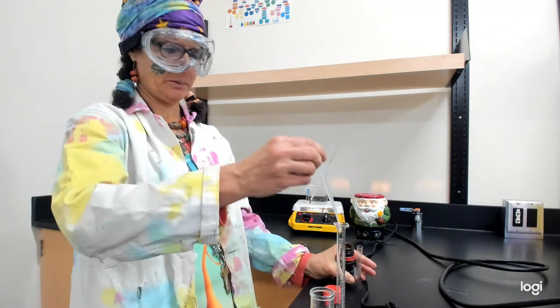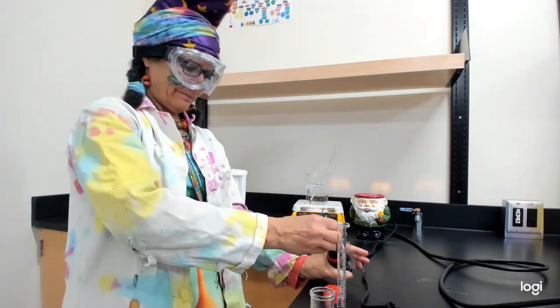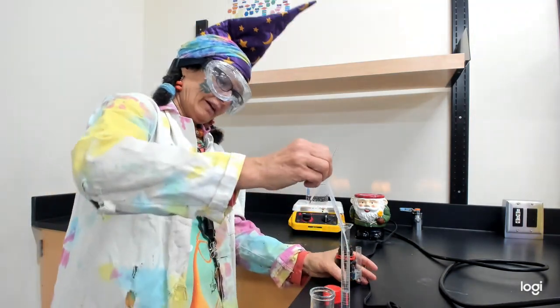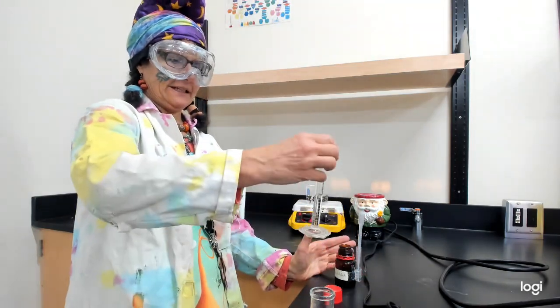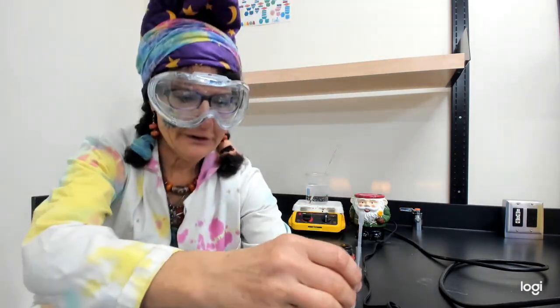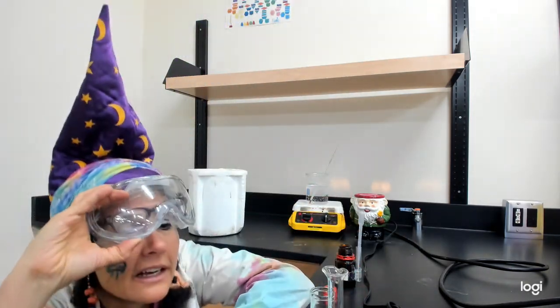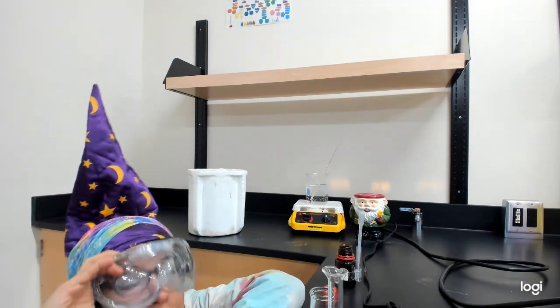Long time to hold our breath. Oh, I had a drip. That stinks. All right. So, you're going to trust me on this. I know how to read this. 5.20.